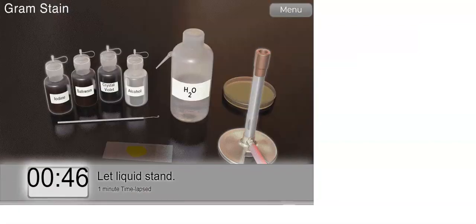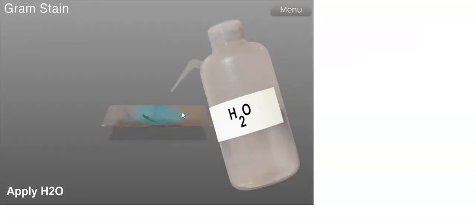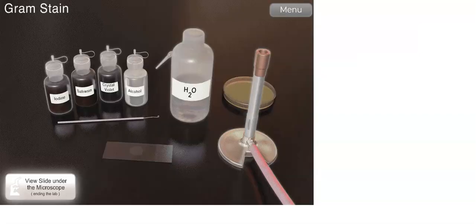Iodine here acts as a fixative, where the iodine fixes the crystal violet into the cell wall of the bacteria by working as a mordant. A mordant is a substance that increases the affinity of the cell wall for stain by binding to the primary stain. The primary stain here is crystal violet. Then we remove the excess iodine using distilled water.